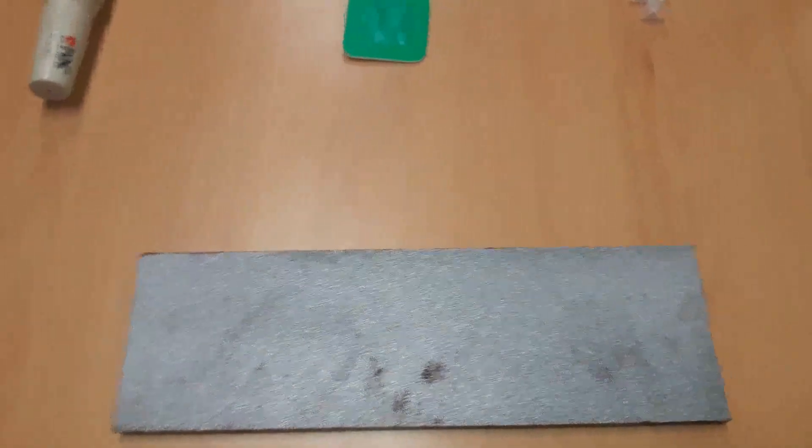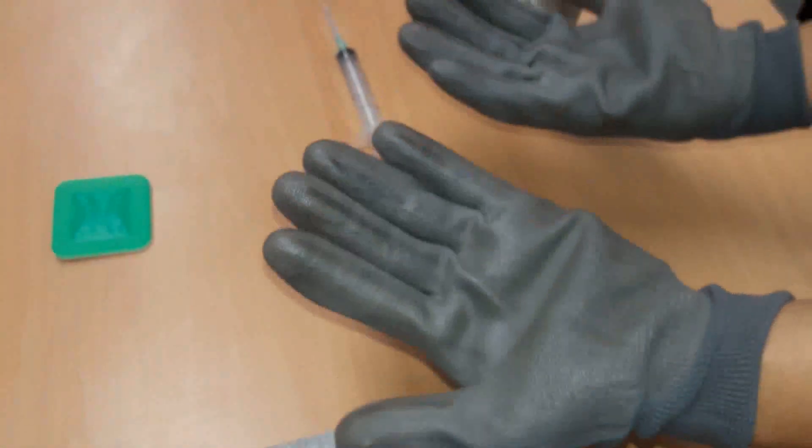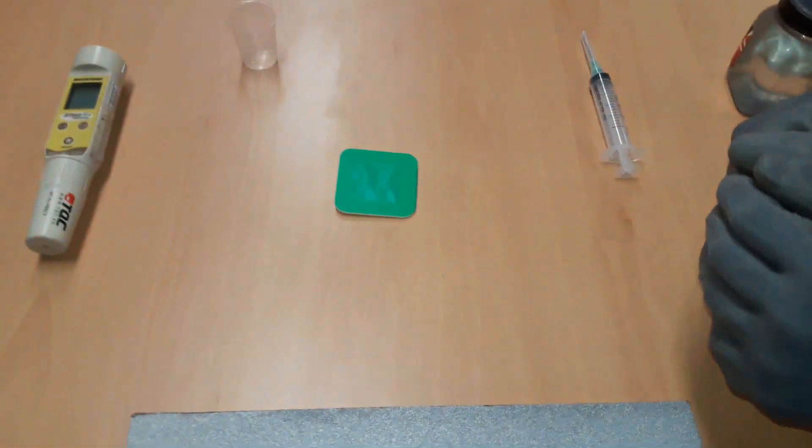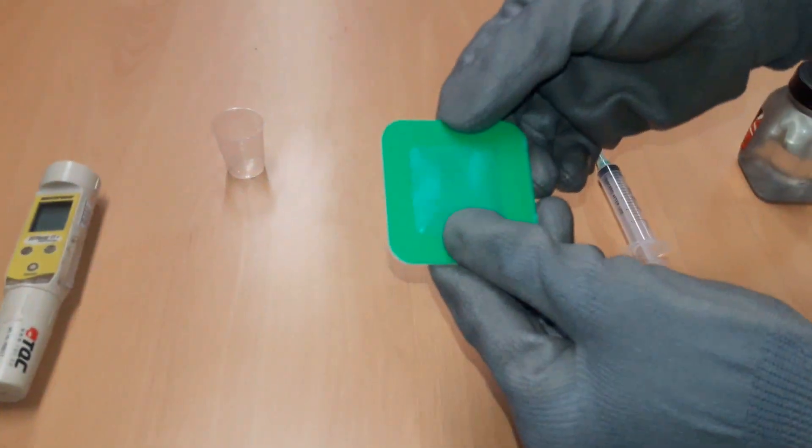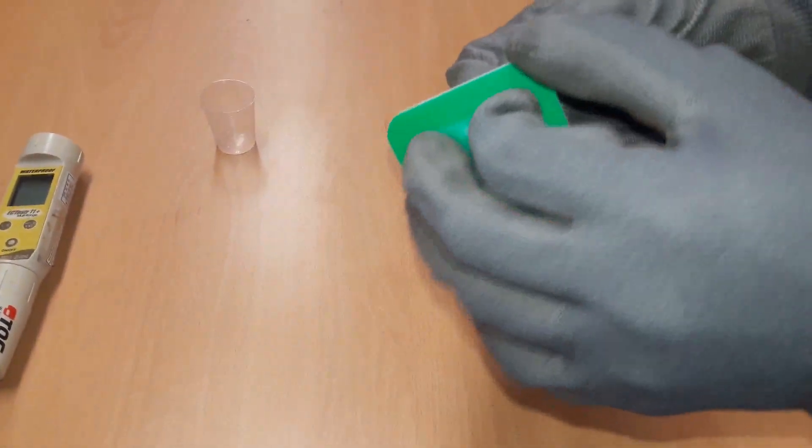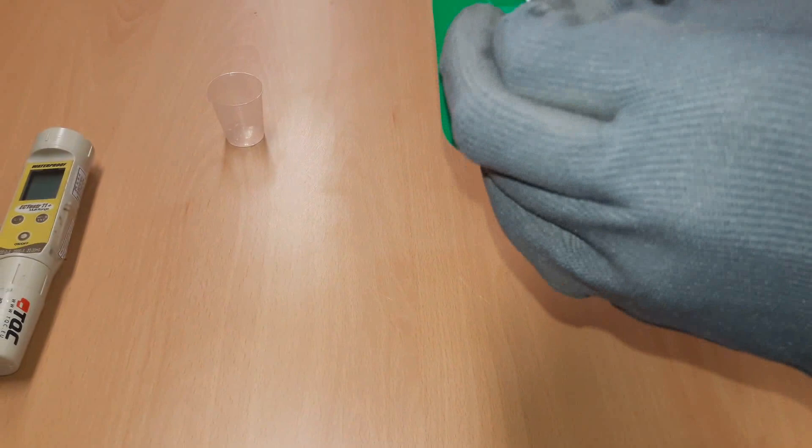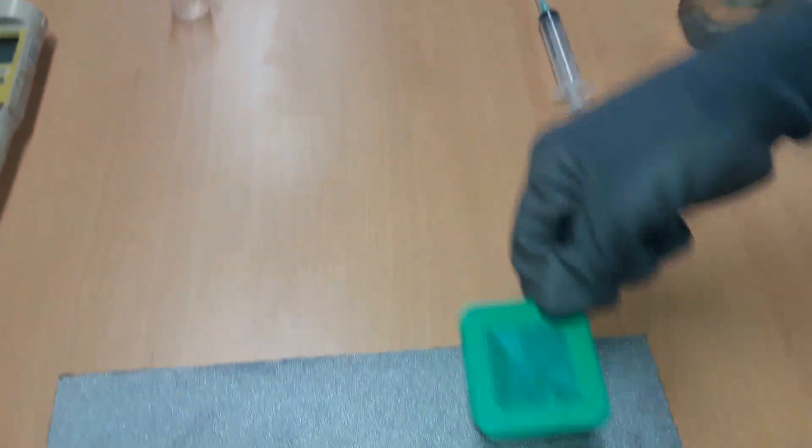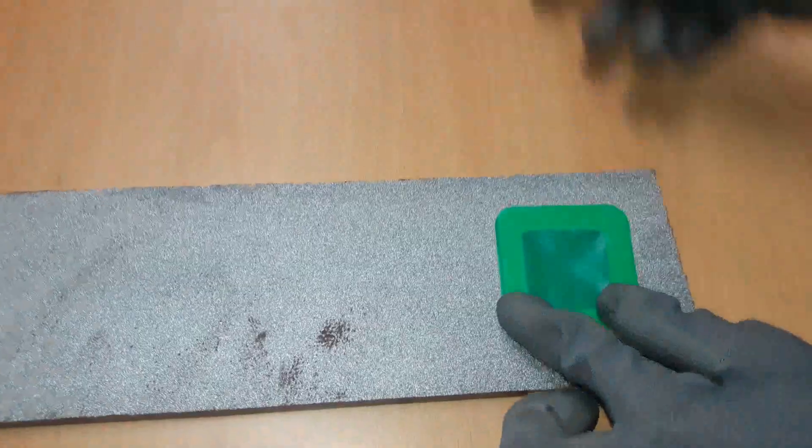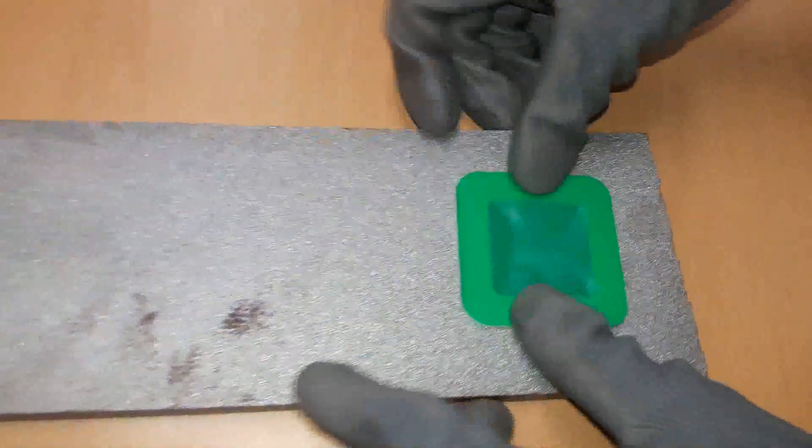Procedure: Wear rubber gloves during measurement. Take the adhesive patch. Remove the protective paper and punch out materials. Press adhesive patch against the test surface in such a way that the minimum amount of air is trapped in the compartment in the patch.